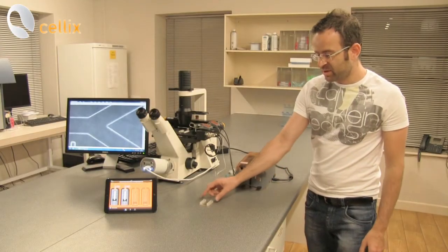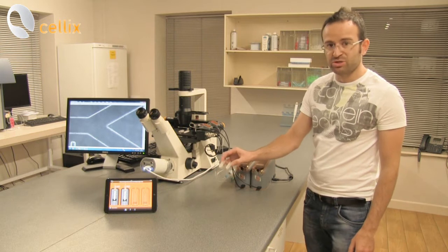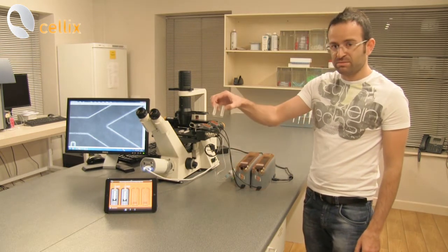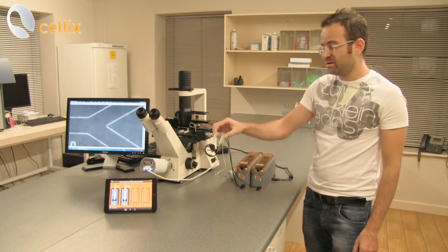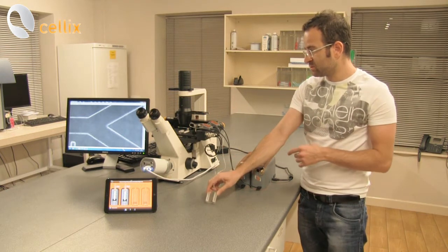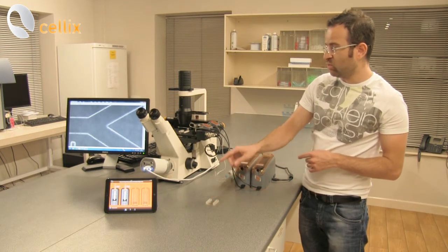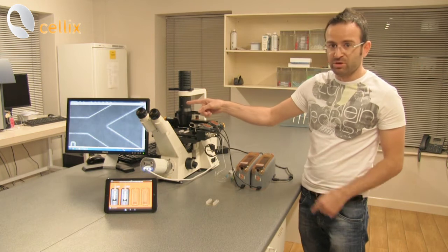For this experiment we are using a special y-junction biochip. This is the biochip. We have another biochip which has been fitted on the microscope and the y-junction as we can see on the monitor there.